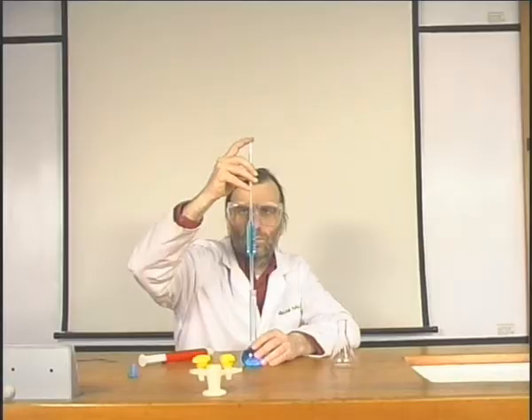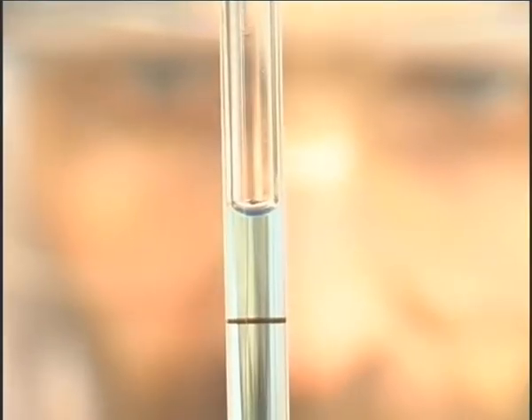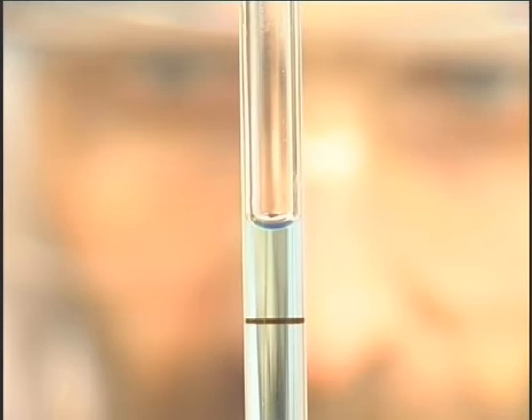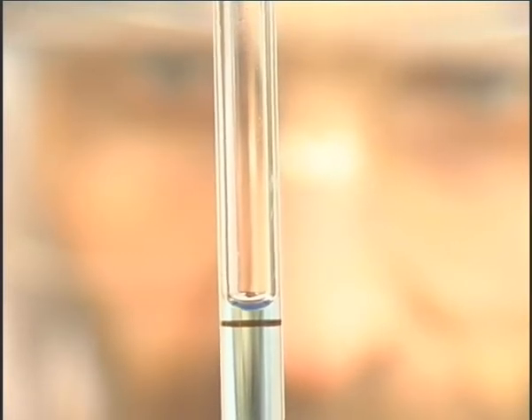While viewing on a level with the mark, the pressure of the finger is slightly released so that the liquid level slowly falls until the bottom of the meniscus just touches the mark.